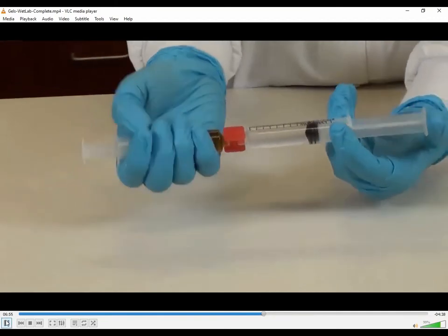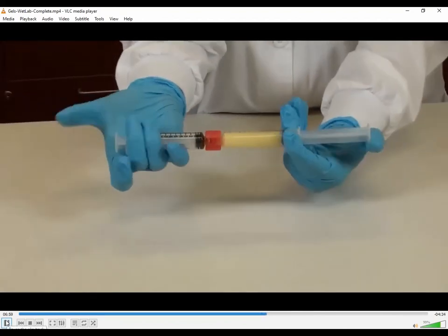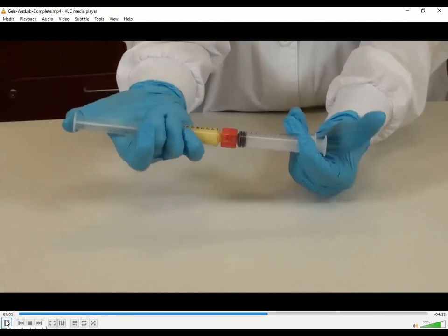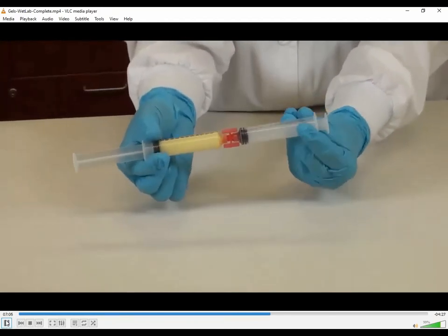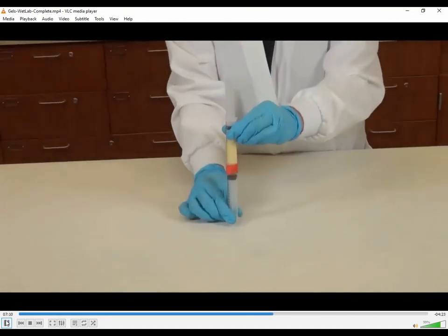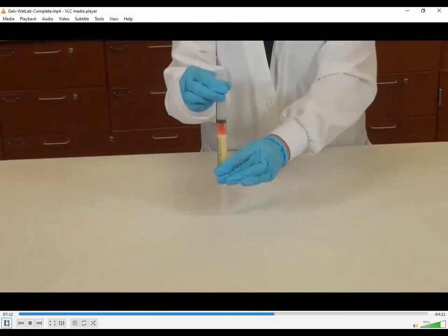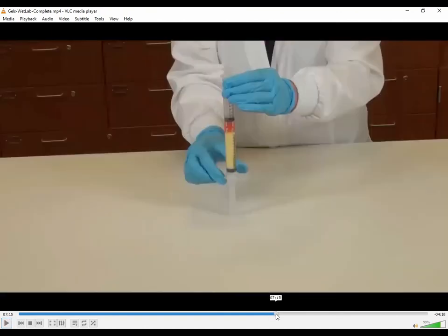Do it side to side, back and forth, and back and forth. You want to rapidly move the solution from one syringe to the other, or you can use the counter and push it and just rotate it. How many times did I say you need to do that? 40 times, because it is important to make the mixture an emulsion. You'll notice when it first starts off, they're both kind of clear. Now it ends up cloudy. Why?